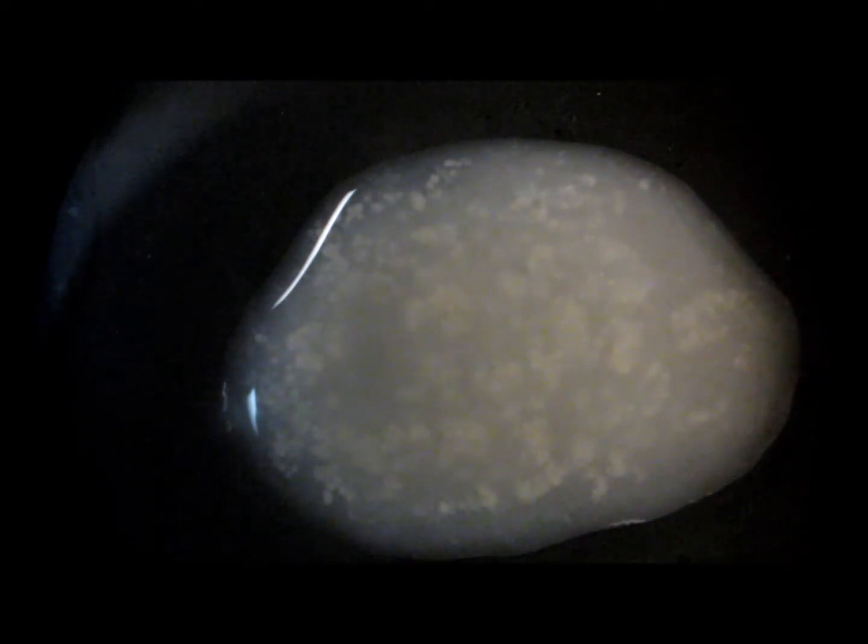When you are done mincing the testis, there should not be any big clumps remaining. The testis should have this pudding-like texture.